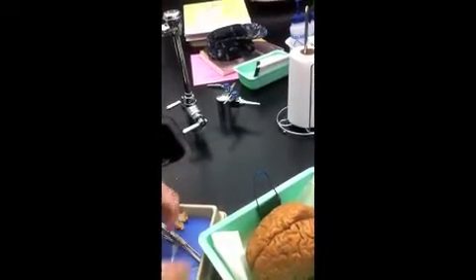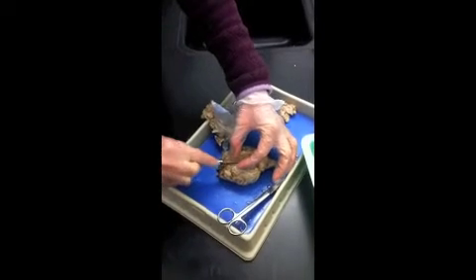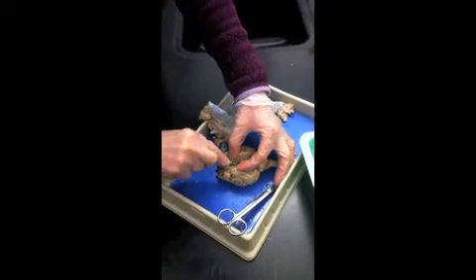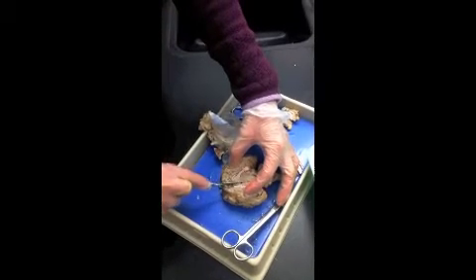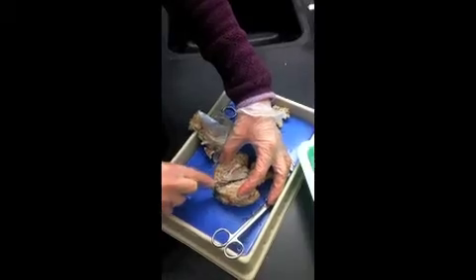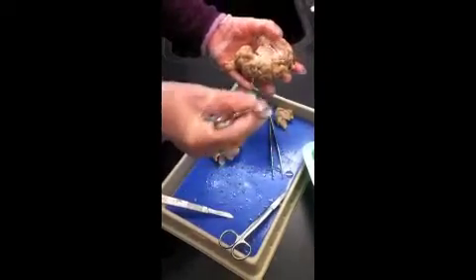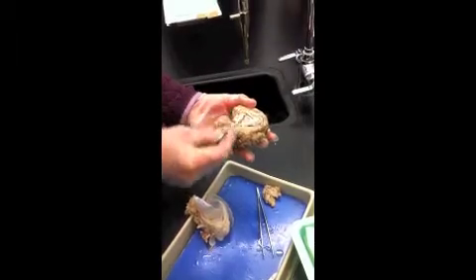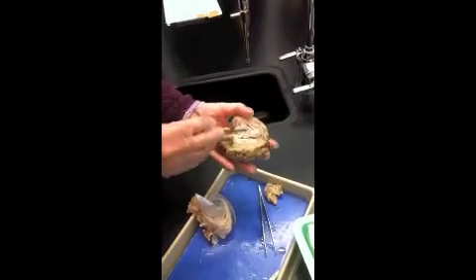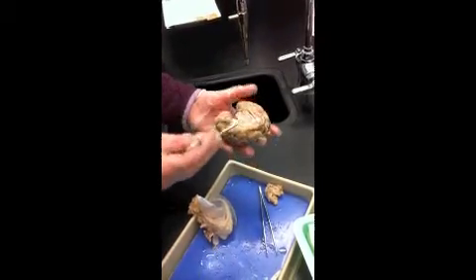Let's make a cut. So I'm going to make a mid-sagittal cut through the cerebrum. Remember all these hard ones that are hard to remember. Okay, so here we see the white is the corpus callosum on either side. That was a transverse bridge. This kind of pinkish area in here is diencephalon, or thalamus.